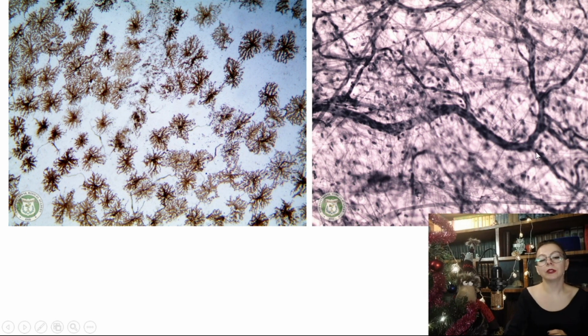Then this is the specimen of loose connective tissue, areolar loose, and here it is stained with the iron hematoxylin, shades of gray. So loose connective tissue is difficult to confuse with other specimens, and just the color is very helpful. And also, of course, you can see here many blood vessels and elastic fibers forming this interconnected network, but it doesn't matter. I think the specimen is very unique.